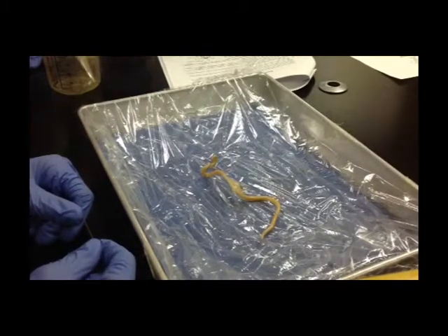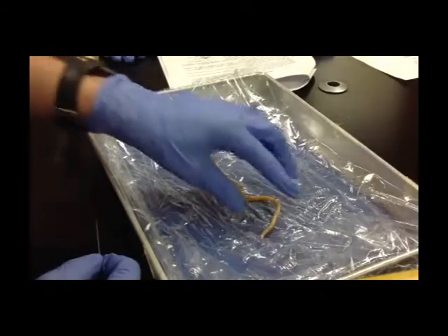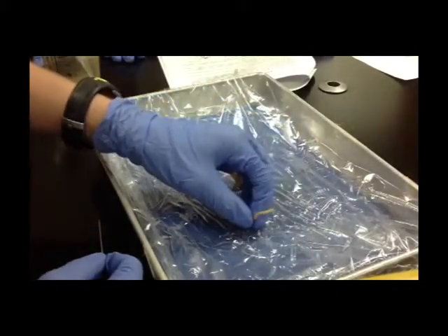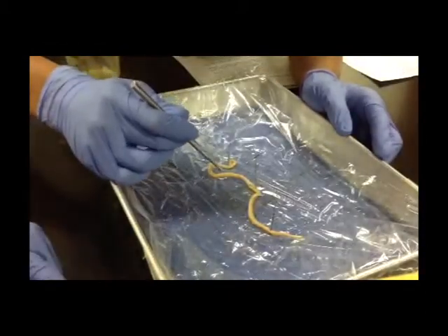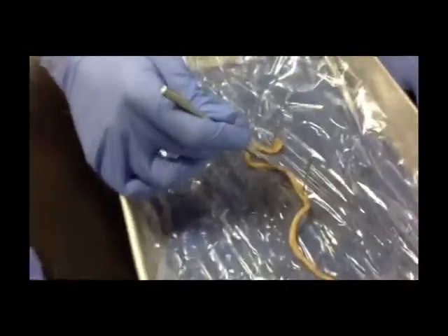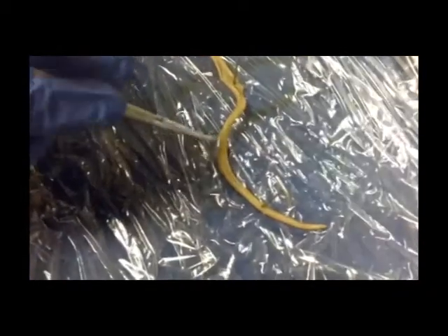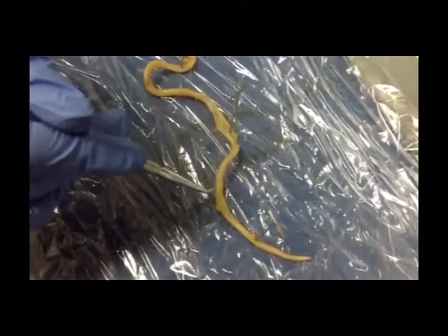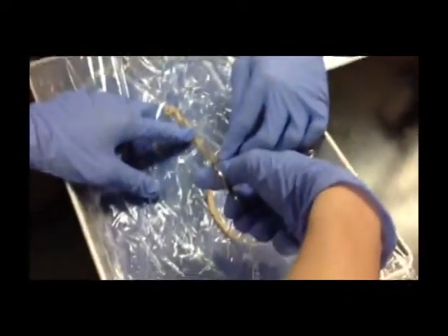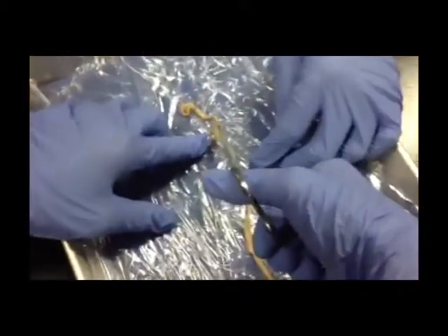The anterior end is somewhat larger than the posterior. This is the larger one, so it is the anterior; this is the smaller one, so it is the posterior. If you look really closely, you can see bristles of some sort sticking out that allow it to move. It has a somewhat smoother surface on the outside; it is not very thick, which probably allows it to move through a human body very smoothly.